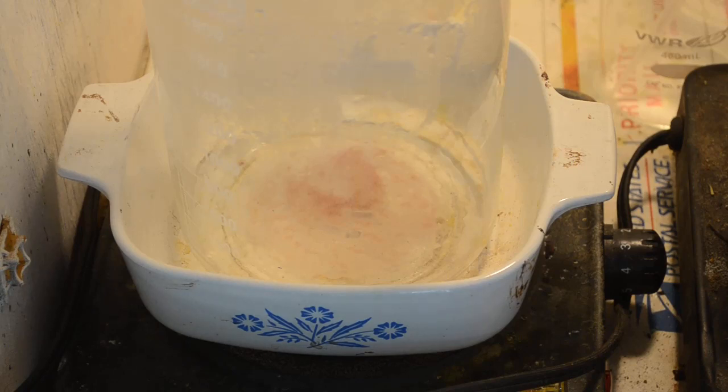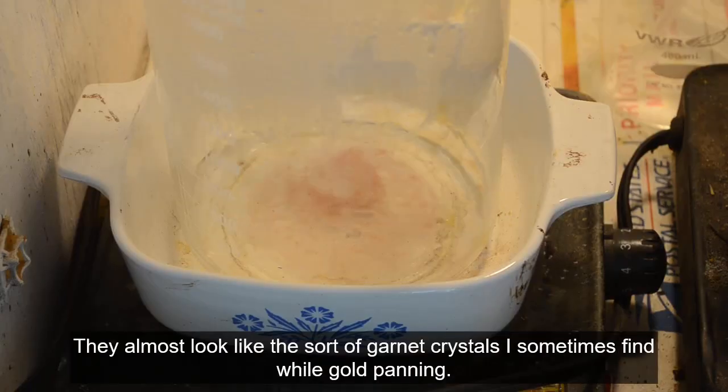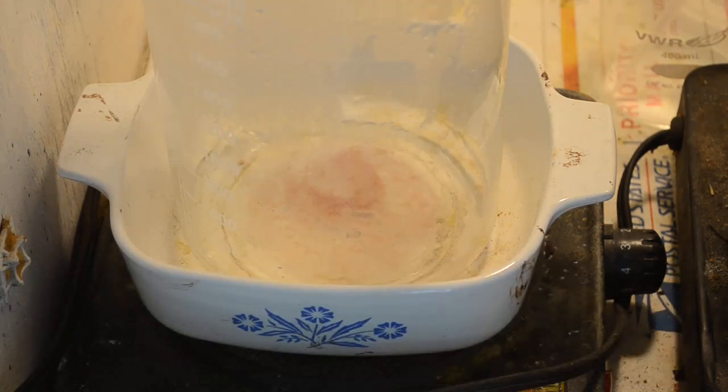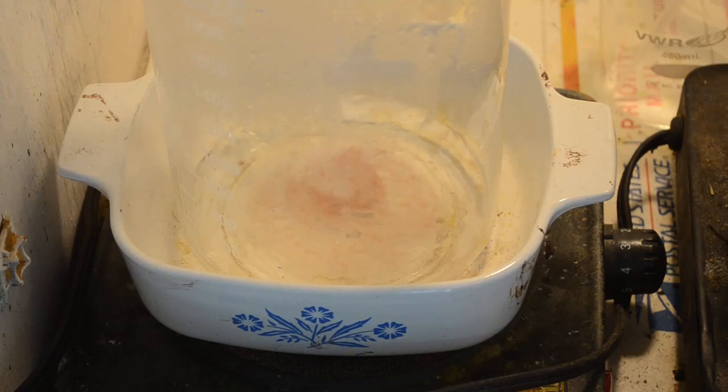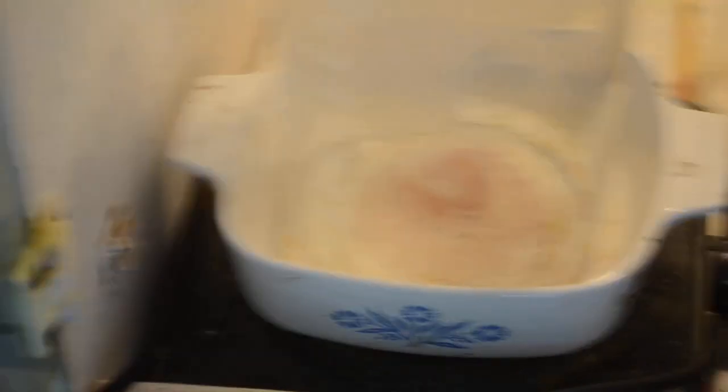In this beaker are some pink crystals. They were left in the bottom of the beaker where I just recently dissolved some cemented gold from Eco Gold X. I cemented it out with zinc, dissolved the excess zinc away with hydrochloric acid, then put the remaining black particles — the metal cemented out that didn't dissolve in the hydrochloric acid — into the beaker and treated them with aqua regia. I got some gold over in this other beaker, but strangely there are also these pink crystals left behind.